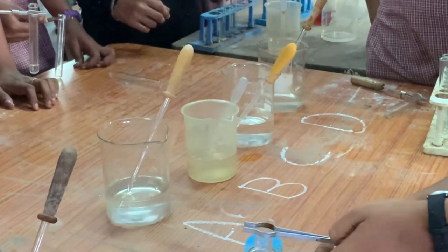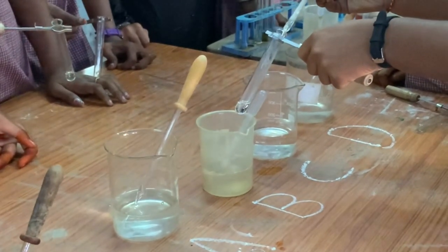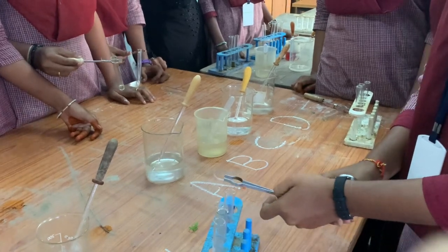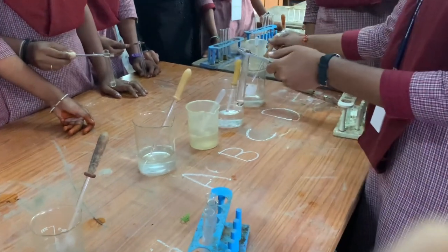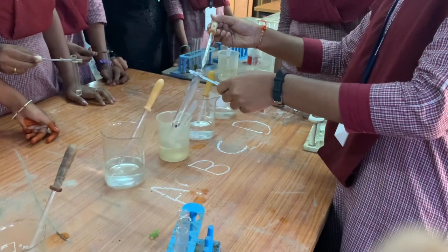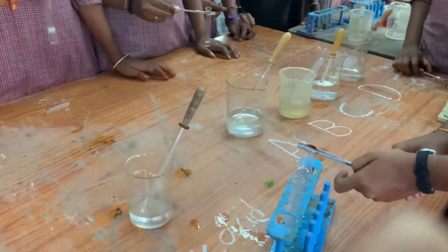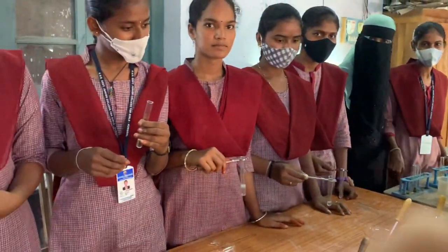Take the 3rd test tube and add sample C, continuing the same process for all the samples. The ring is not formed, so albumin is absent in sample C. In sample D also, albumin is absent. From this we can confirm that sample B contains albumin.